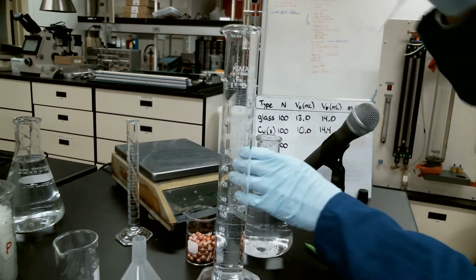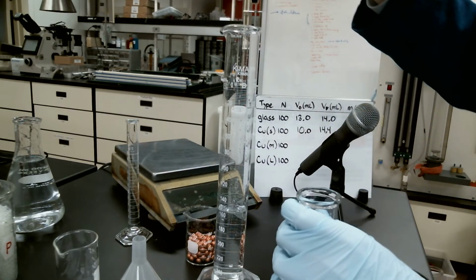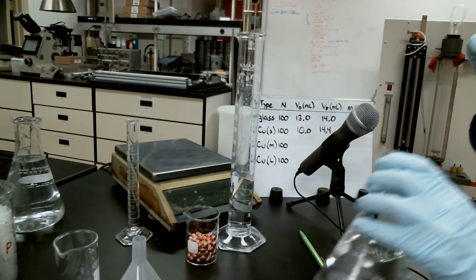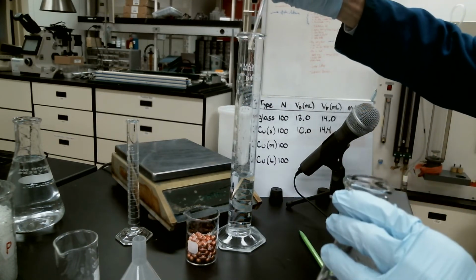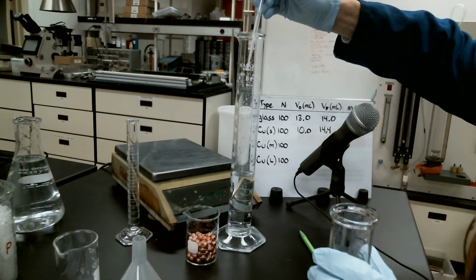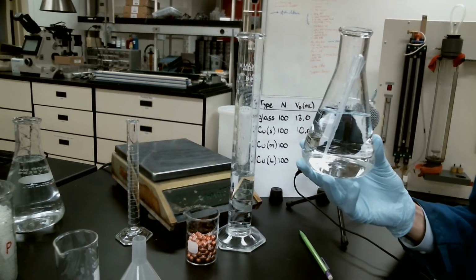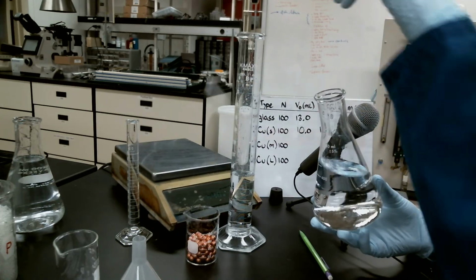There's that. Let's grab a little bit more water inside of here. And we'll add a little bit more. We need about that much again to get us right up to about 100 mils. There we go. We're at 100 mils. I just managed to lose my disposable pipette in there. There we go. I really need that.